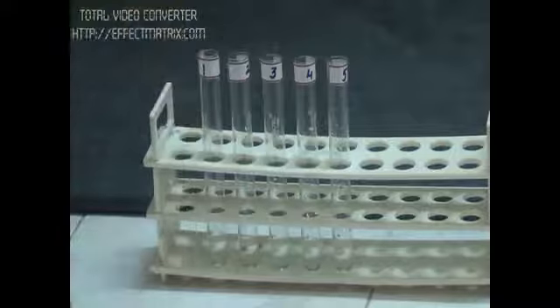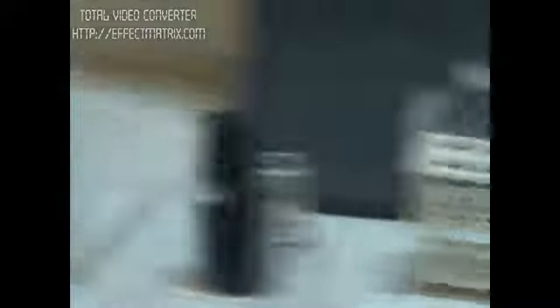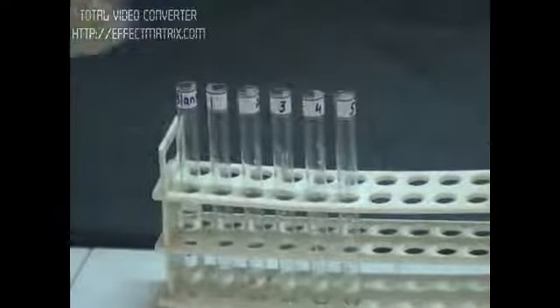Now we add 9.5 ml of 0.1 N NaOH. What is happening in the reaction is that PNP, para-nitrophenol, is going to give us yellowish color when it is in basic conditions. By adding 9.5 ml of NaOH, we are providing the basic medium. Thus our PNP will give us yellowish color according to the aliquot we have taken.